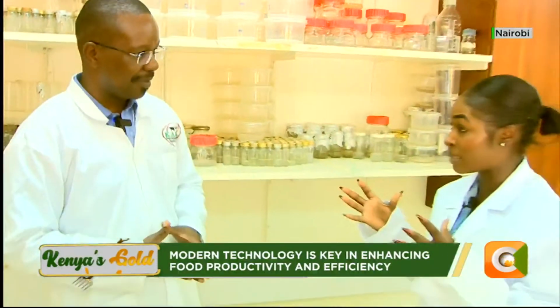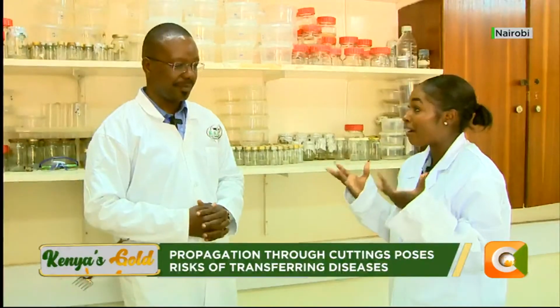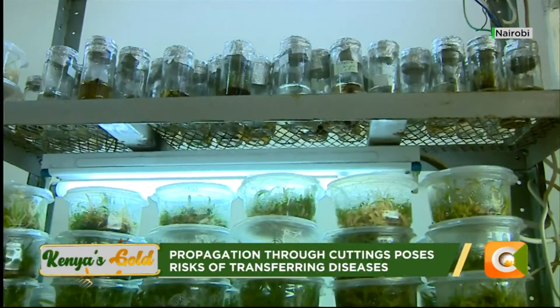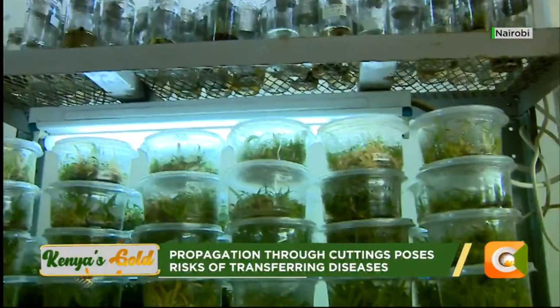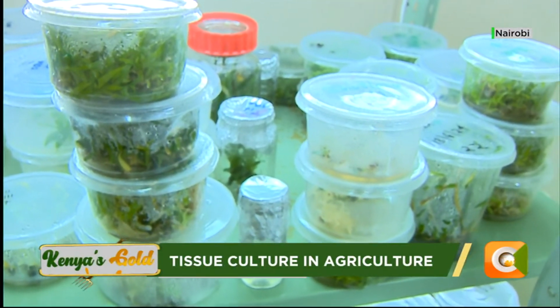Right. Talk to us about the different crops that can be propagated through tissue culture, and are there other crops for which the technology has not yet reached the level of propagating through tissue culture? Yes, like I said earlier, there are crops that we are yet to get protocols for, because getting a protocol for tissue culture sometimes takes time.